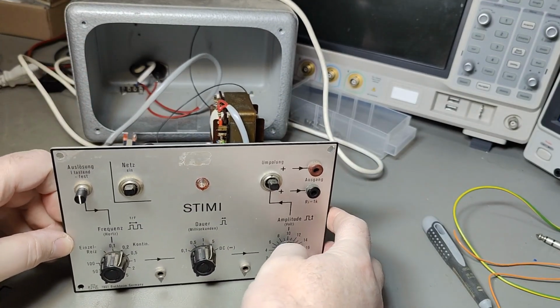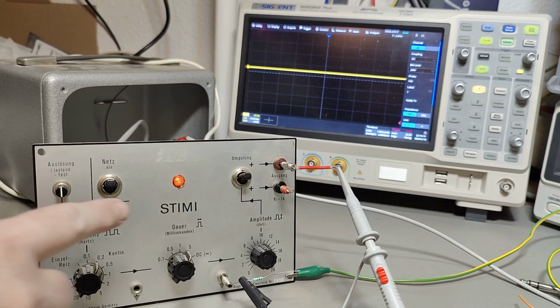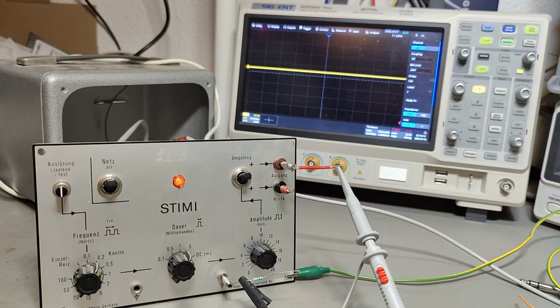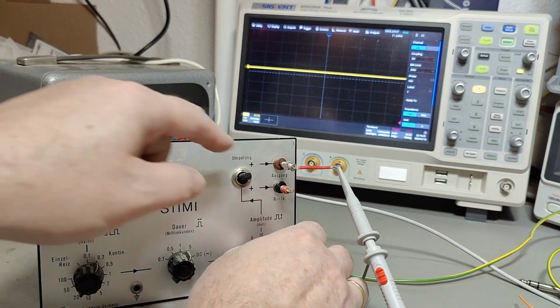So I think I am ready to plug it in and crank up the voltage. Let's just go straight to 220 because I see a lamp and it's only using about 3 watts. Okay, 180. Okay, 220 volts and 9 watts, but I don't see any kind of output pulse. So what am I doing wrong here? Is this the... Nope.